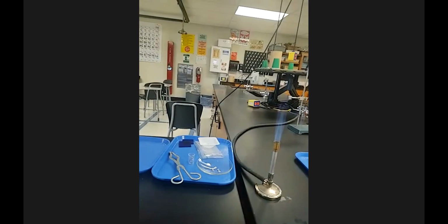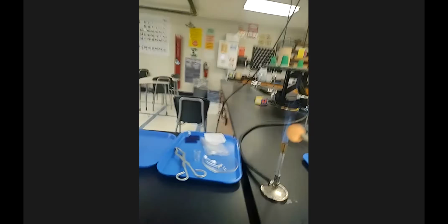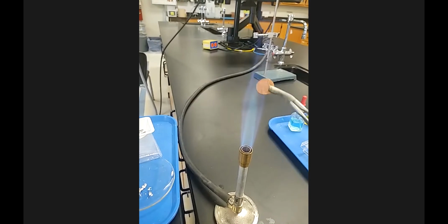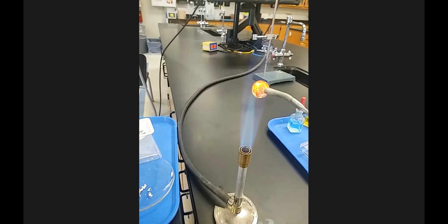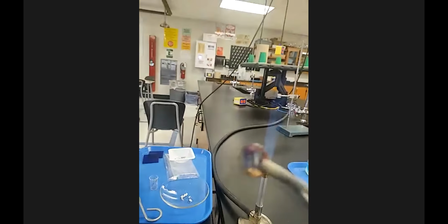Heat this in the flame for about 20 seconds and then show you guys what it is after. So this, I'm not gonna try and heat it in the super hot part of the flame, but I am gonna heat it until I see a little bit of a difference, and then bring it back over here for you guys to see. Oh yeah. So that's the back side. There's Abe. It's multicolored, tectonic, techno Abe.